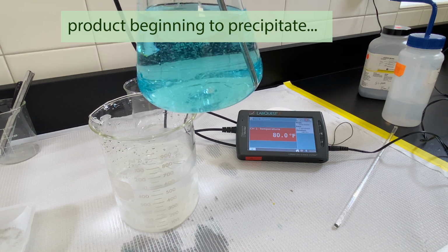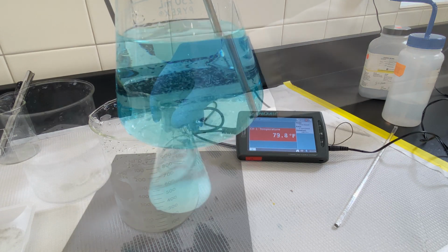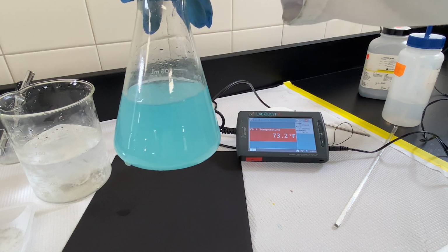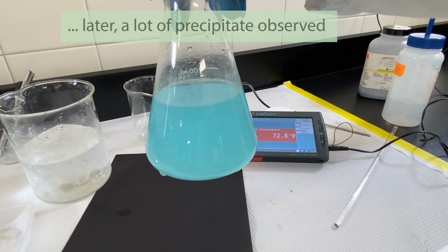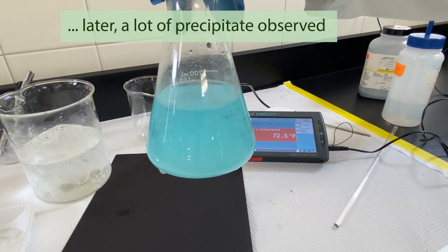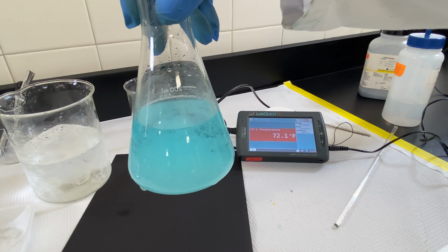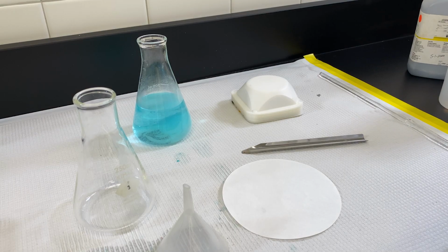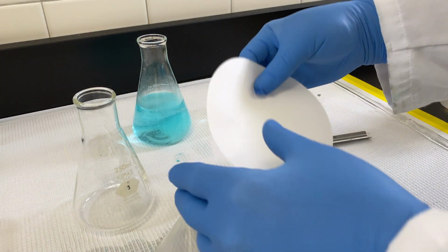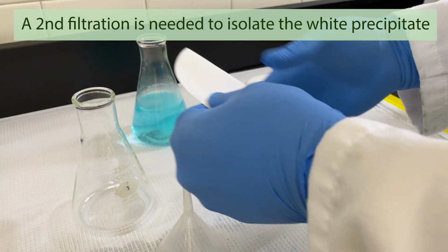So as we cool it down to about 80 degrees Fahrenheit, we can see that there is white particulate matter. Cooling it down further, we get a lot of the precipitate formed. That is our product that we're looking for. So to get the white particulate matter out of the blue liquid, we need to do a second filtration.